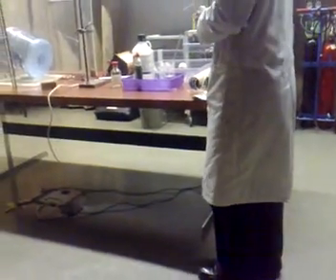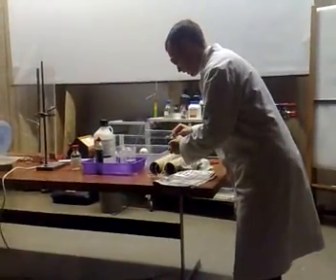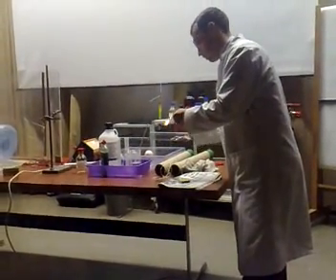Awesome. This is why chemistry is stupid. Okay, let's get it working again. There's enough. I think the sentence wasn't quite correctly constructed there. Chemists. Sorry, yeah. Okay. Lights. Sit in it this time.